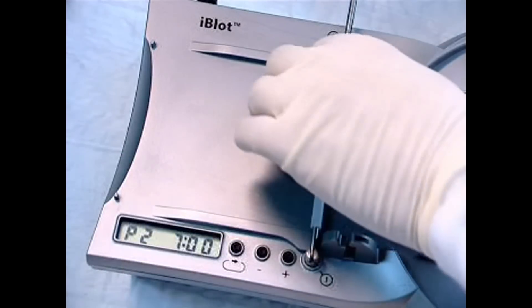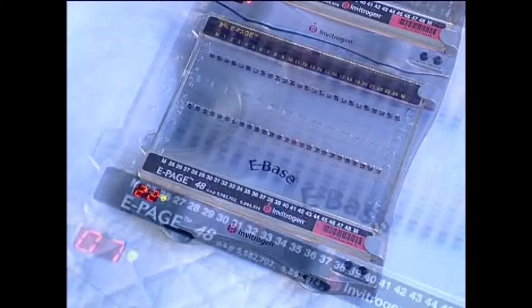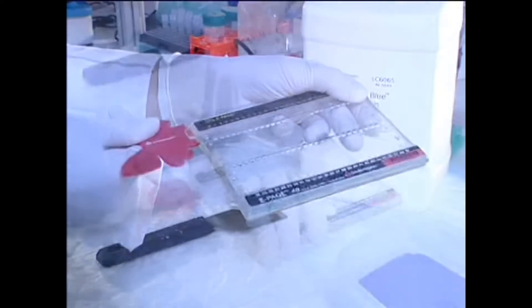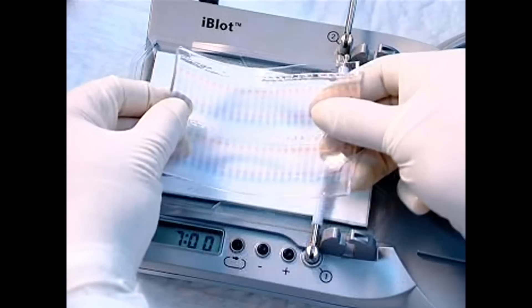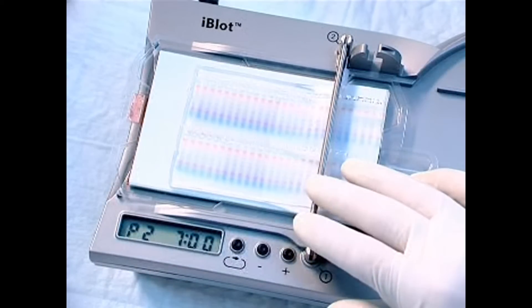The iBlot system is designed to blot Invitrogen bufferless ePage gels as well. The debubbler unit is used for easy bubble-free assembly.